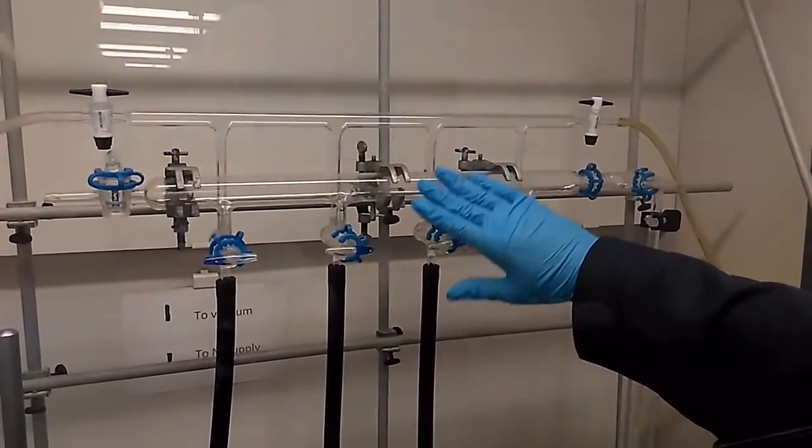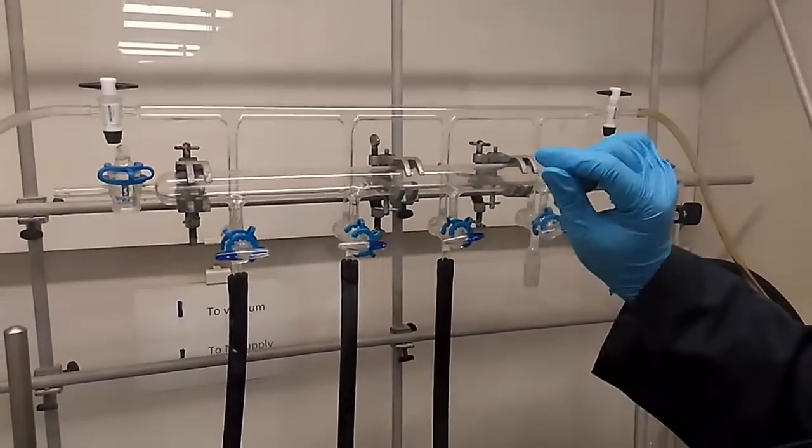So at any part of time, we should only allow one of these pipings, either the nitrogen or the vacuum, to be connected to our system.